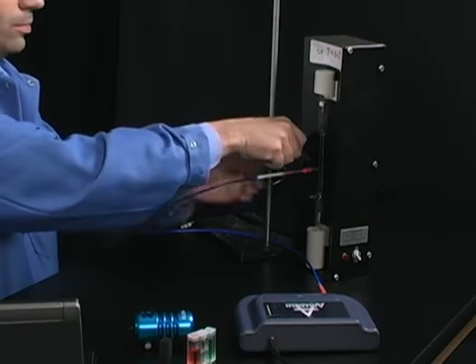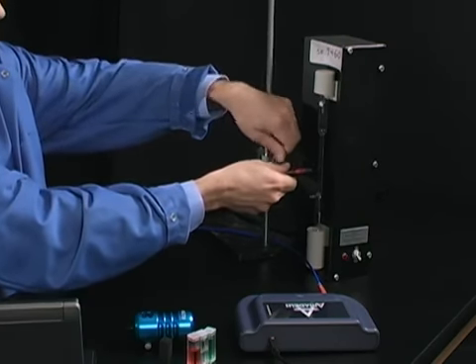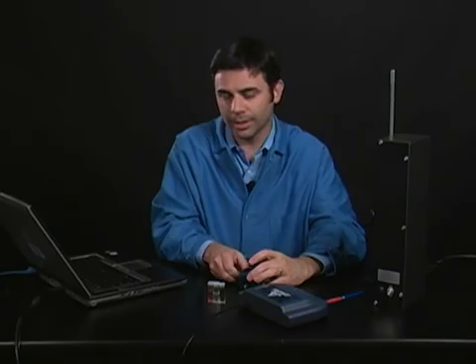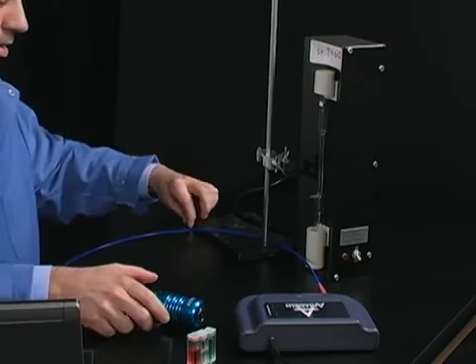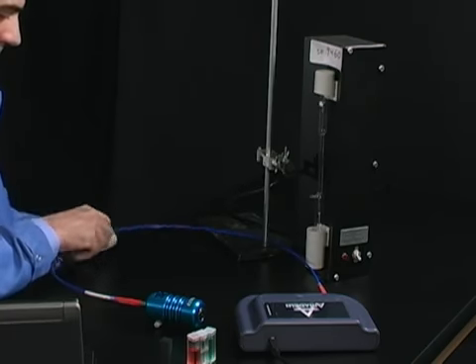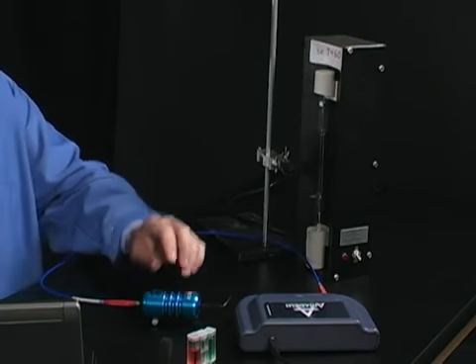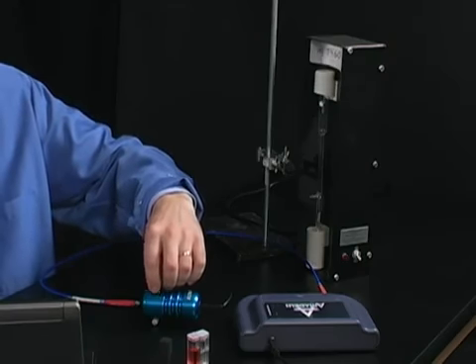And now we need to reconfigure the Amadeus a little bit so that it can hold the samples. So now we're going to shine a light through samples instead of looking at a sample of colored light. I'm going to attach my fiber optic cable here. And this is a little light source that can be plugged in. And now there is a light in there that will shine through the sample.